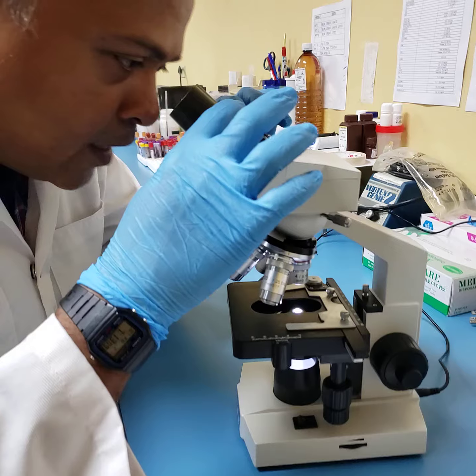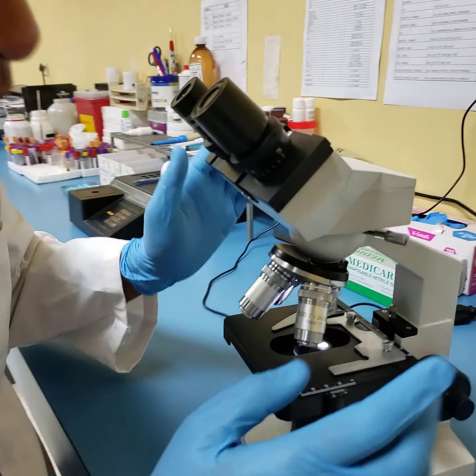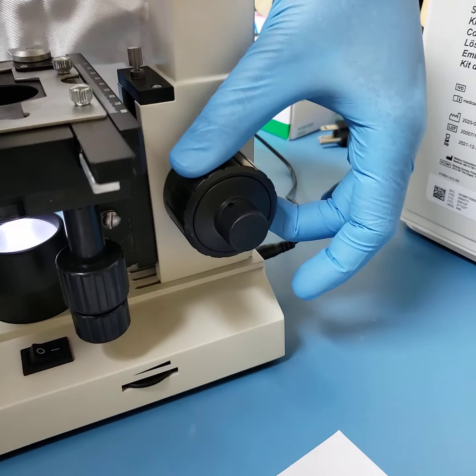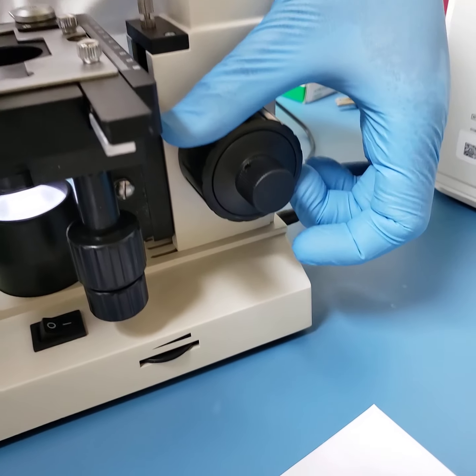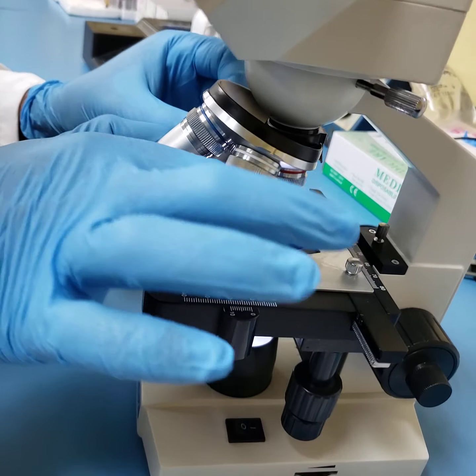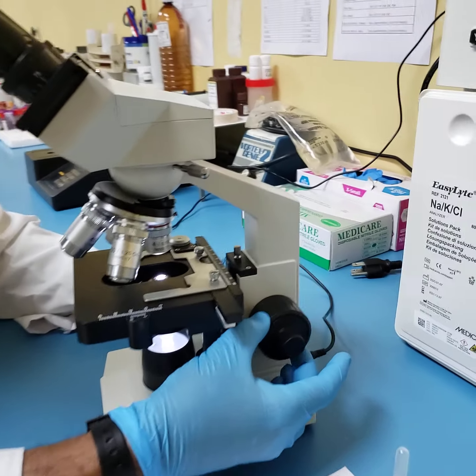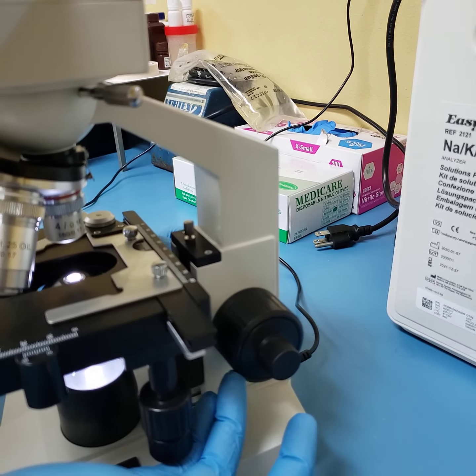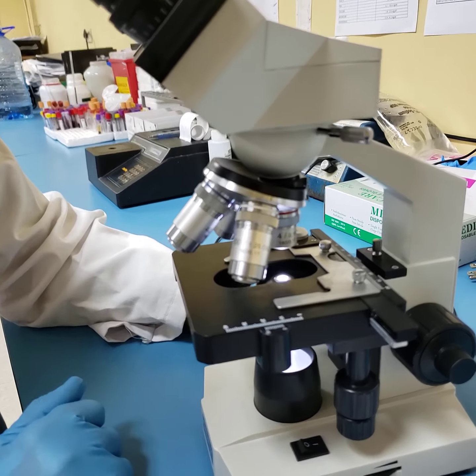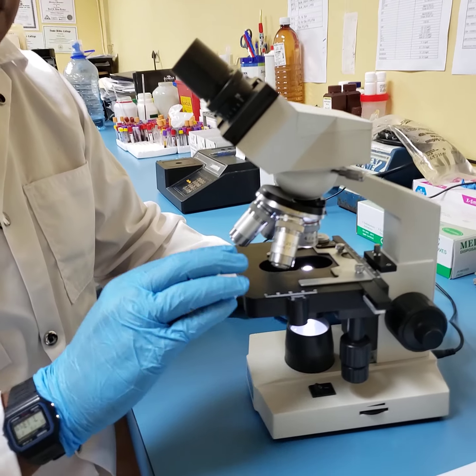All right, so let's recap again. Power on, eyepieces adjusted to suit your eyes, as well as making sure you get one zone of illumination. Next step is you turn your stage. You're using your coarse adjustment knob and you turn it away from you. Your stage is going to rise, and as your stage rises, you also simultaneously use your nose piece and bring your lowest lens down. There will come a point when the coarse adjustment knob will not turn anymore, and your shortest lens, your ×4 or scanning lens, is placed completely down. The stage will not go any higher. It will literally just reach a stopping point.